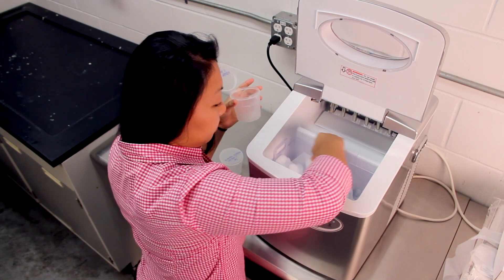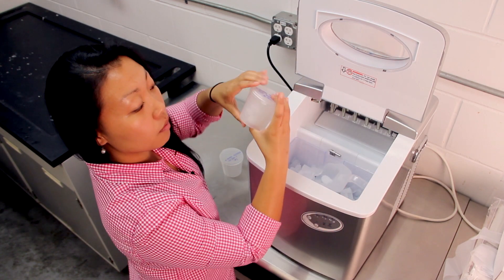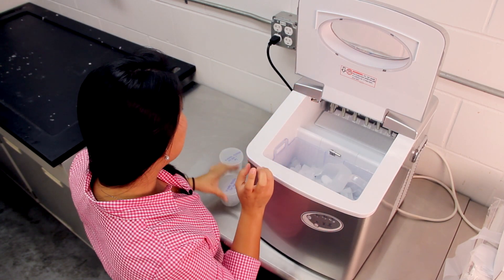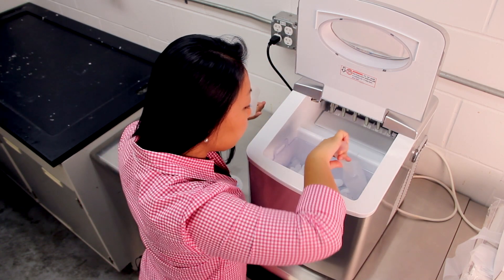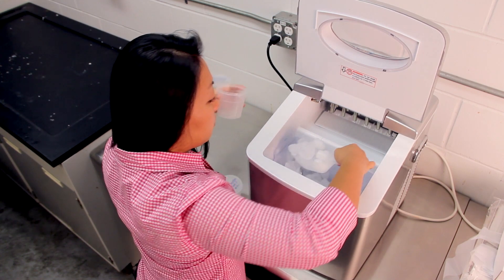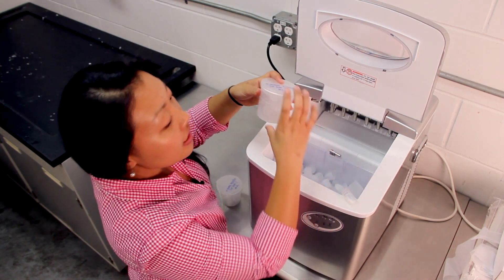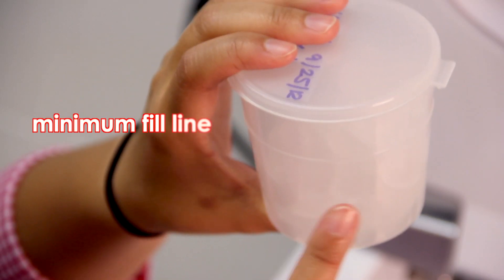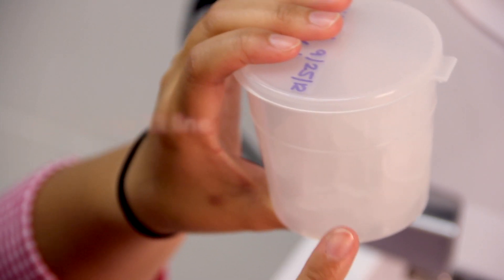I'm going to scoop some ice and pour it right in, then close it right up and tab it. For ice, you need to have two samples, so we're going to go ahead and fill another one. You'll notice there's a minimum fill line — you need to at least put enough ice in to reach that line. If you can put more, that would be great.